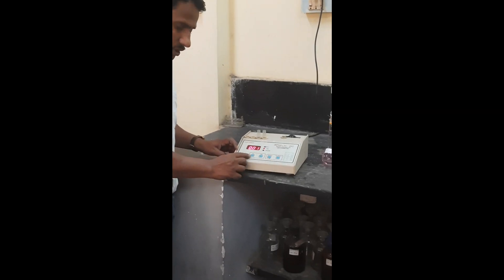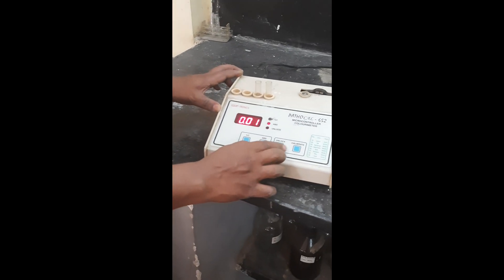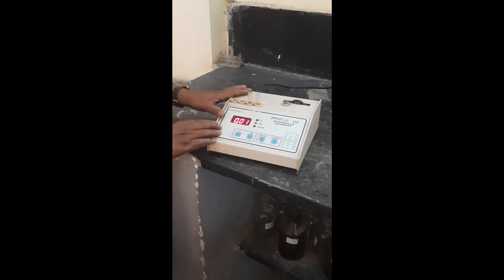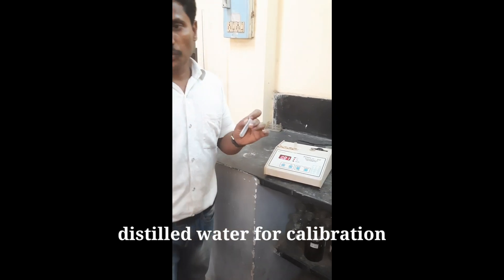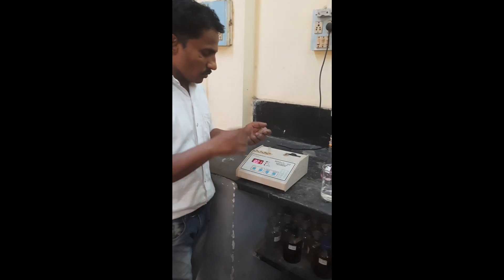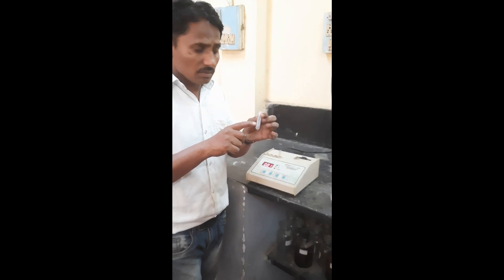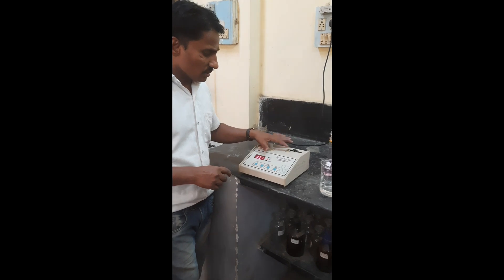Key parameters include percent transmission and absorbance. The instrument is calibrated with the help of distilled water. Using this cuvette, we are taking the solution of KMnO₄ and putting it in the sample cell.